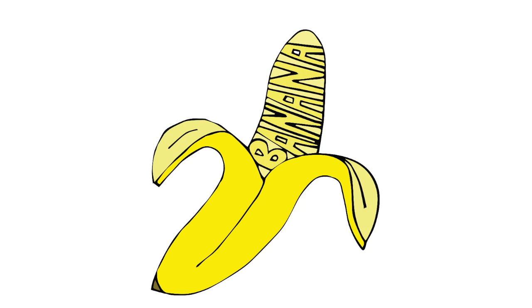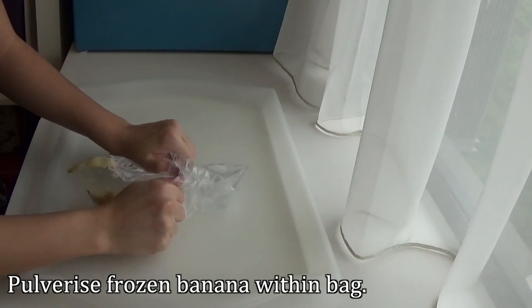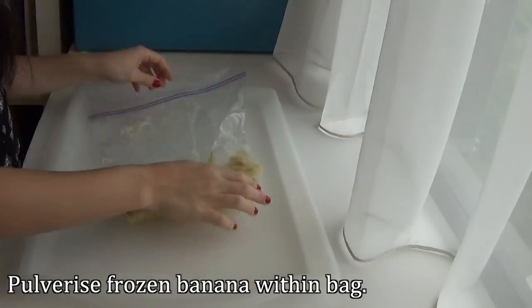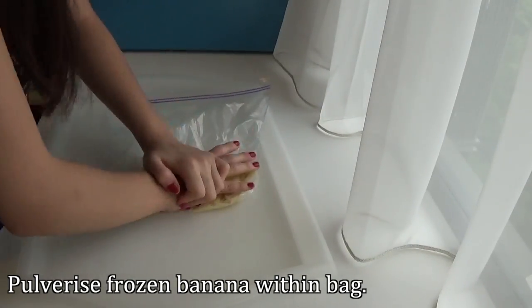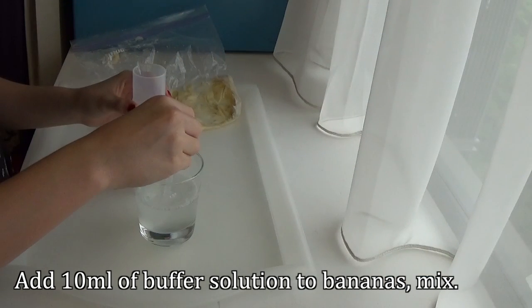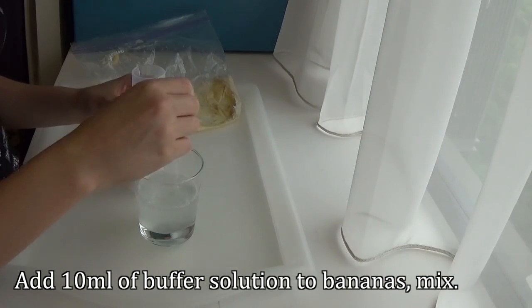Preparing the banana. First, use your hands to mash up the frozen banana. Then, add 10ml of the buffer solution to this.